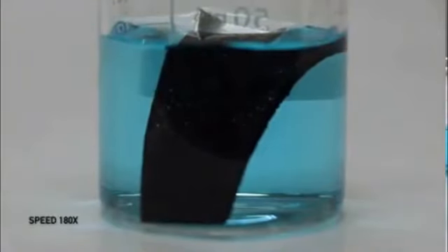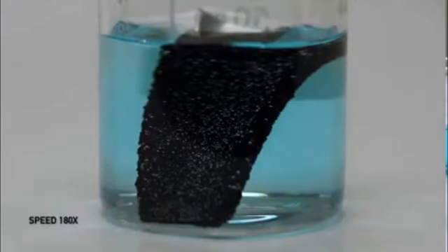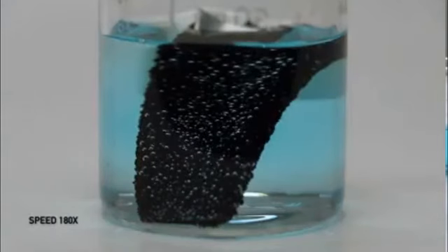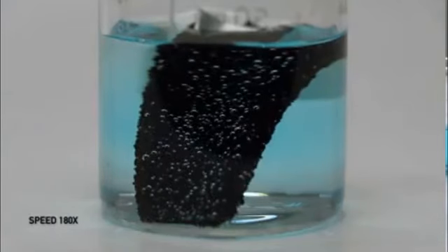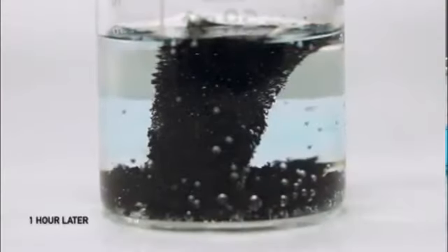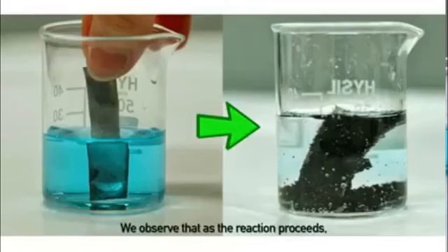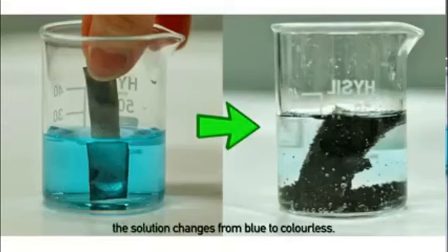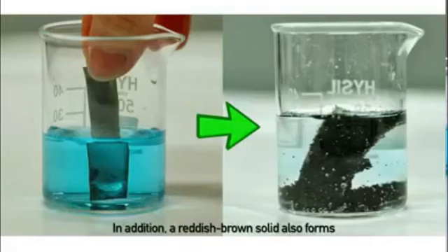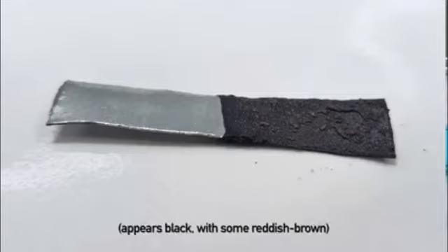Keep it for some time. After one hour, we observe that as the reaction proceeds, the solution changes from blue to colourless. In addition, a reddish brown solid also formed on the surface of the zinc metal.